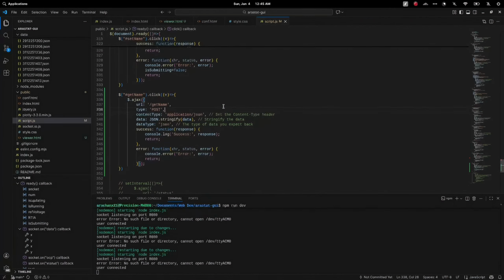The device outputs a variety of data, from notifications to measurement data. To make sure that the machine can process our important data, we format it as JSON so that it can be parsed and processed easily. If you look at the serial monitor, it explains why some outputs have JSON format, so that they can be processed by our web app.